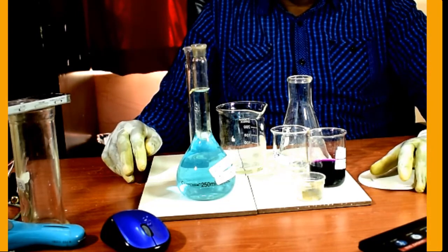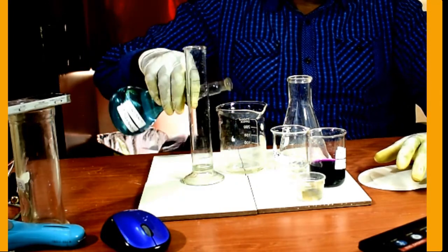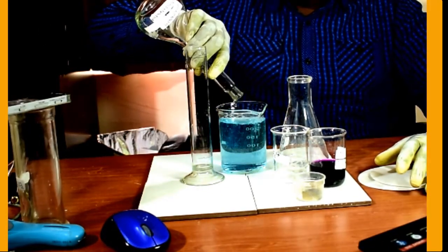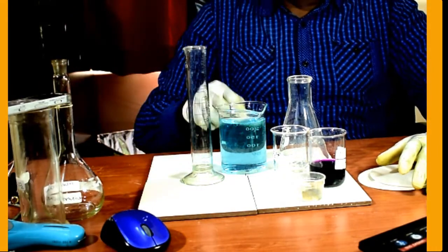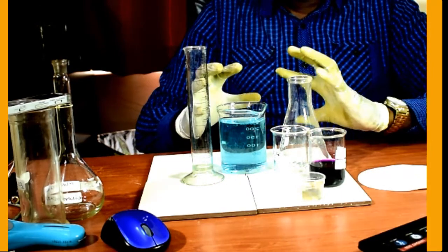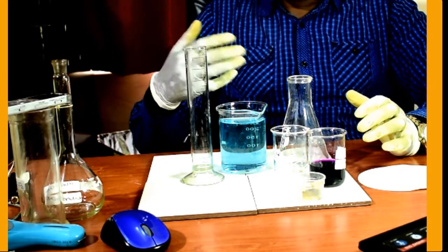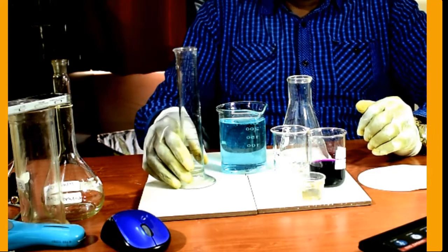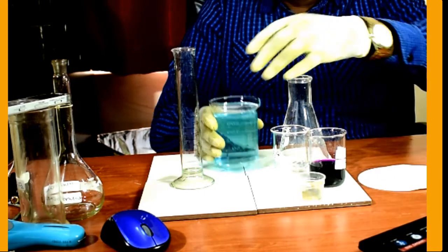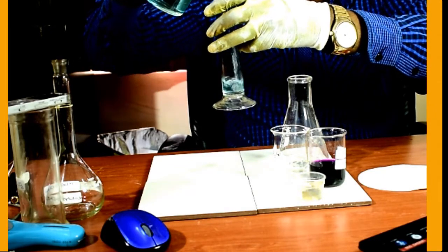You are welcome. So let us start with the displacement reaction that is supposed to take place between iron and copper 2 sulfate solution. So this is copper 2 sulfate solution. It is blue. The blue color is due to copper 2 ions. The ions here are going to be removed by iron metal, and iron metal will release iron 2 ions, which we can titrate with manganate 7 solution. So out of this, I'm going to measure 100 centimeters cubed, or rather 100 mL.